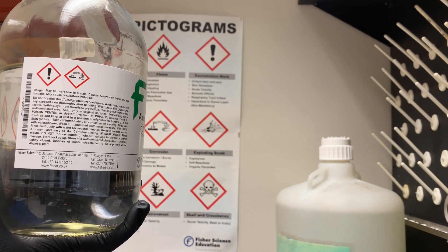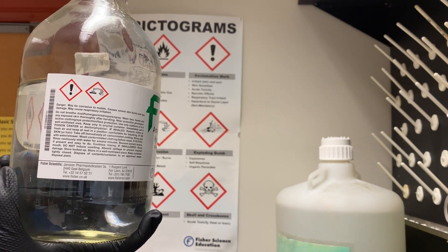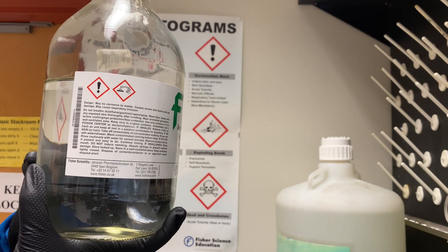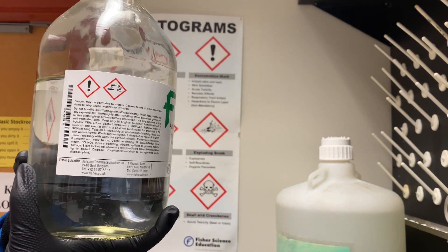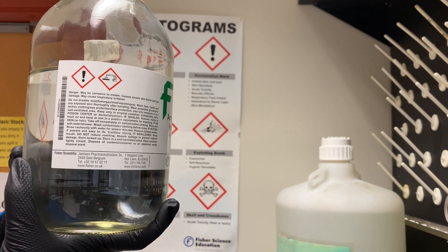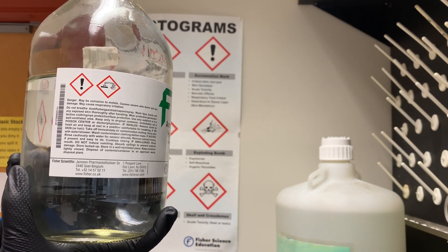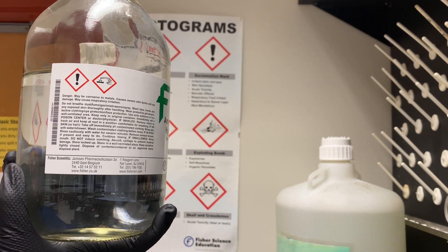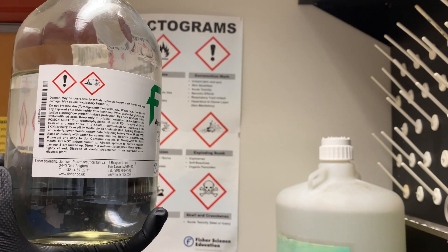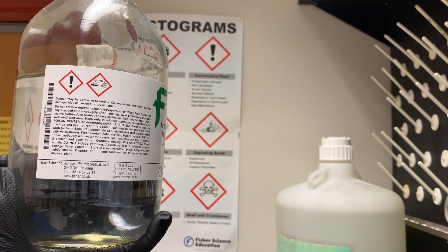With the exclamation mark, this can mean any type of irritant, skin sensitizer, acute toxicity, or respiratory tract irritation. The corrosion symbol can mean skin corrosion or burns, eye damage, or corrosive to metals.